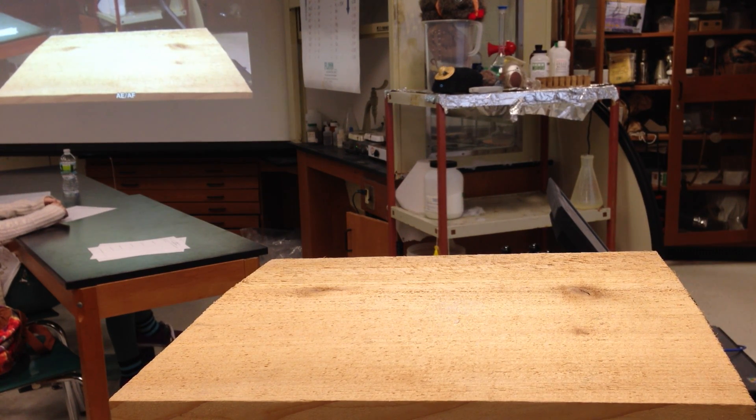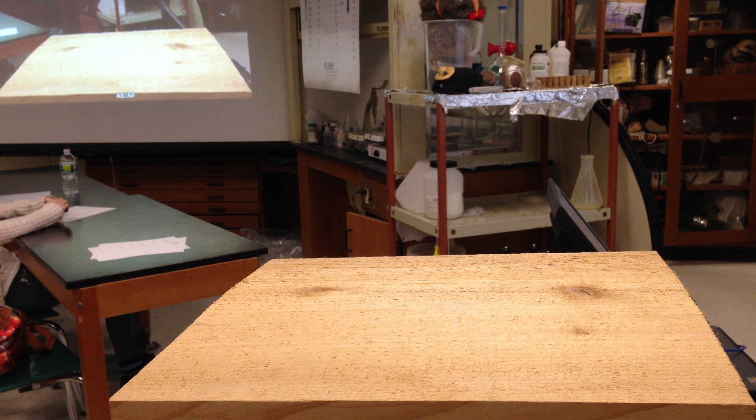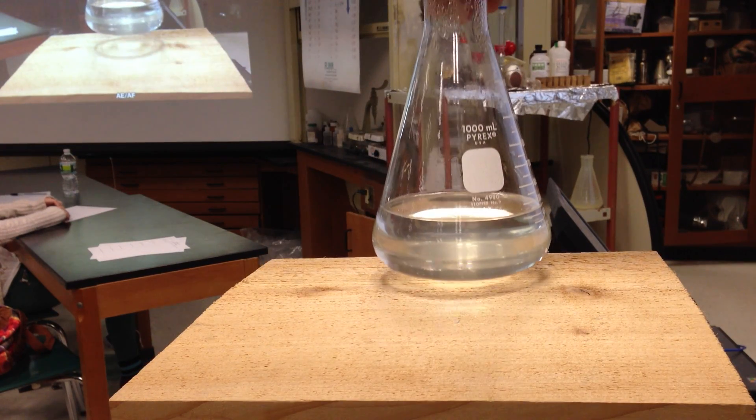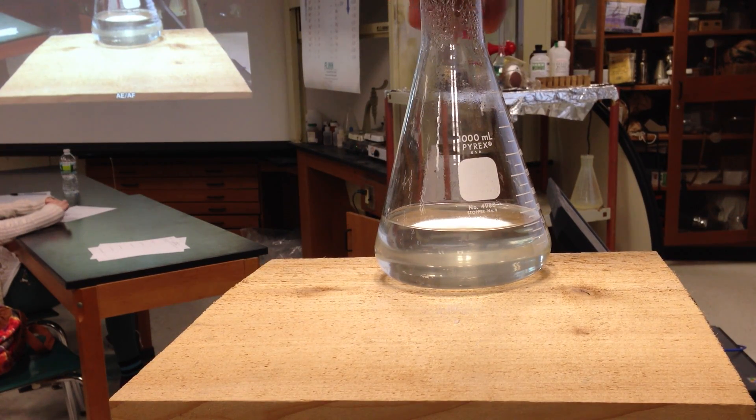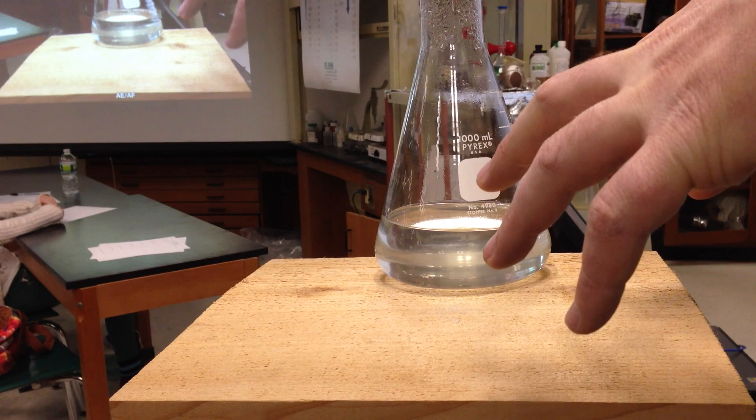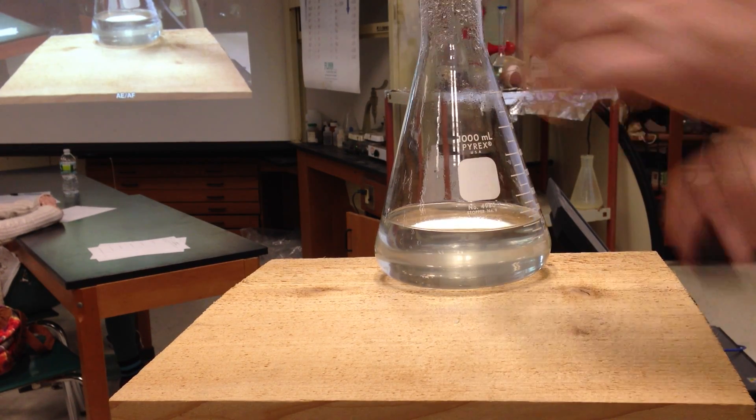...it has already organized crystals to grow from. Right now, this solution doesn't have any organization. So if I drop a seed crystal in that, or I pour it onto the seed crystals, having the organization right there, you can build a crystal from already a crystal being there. All right, so let's do this.